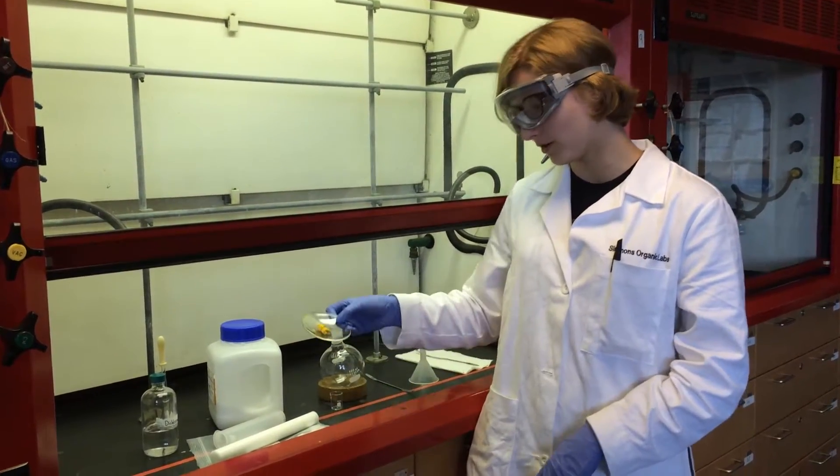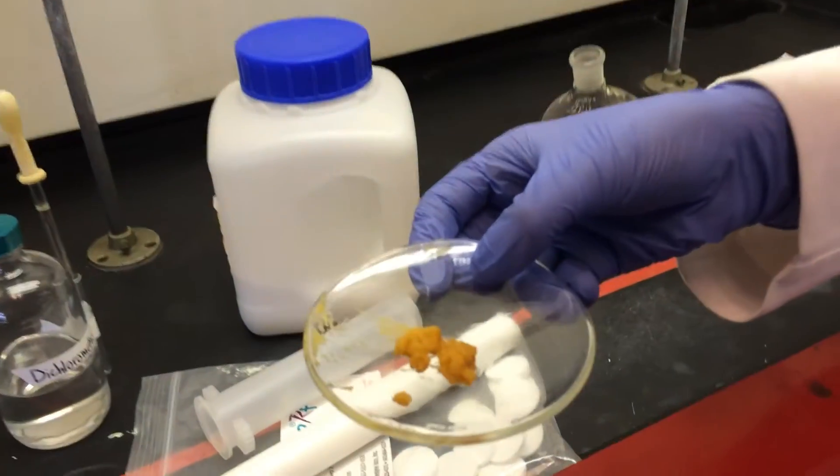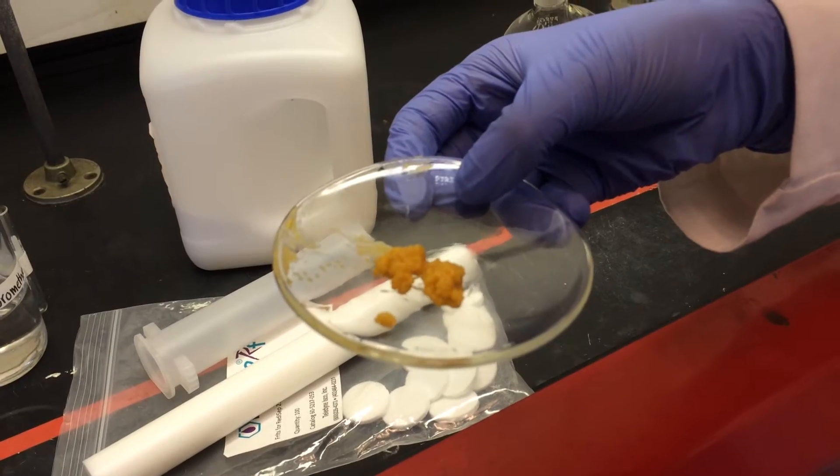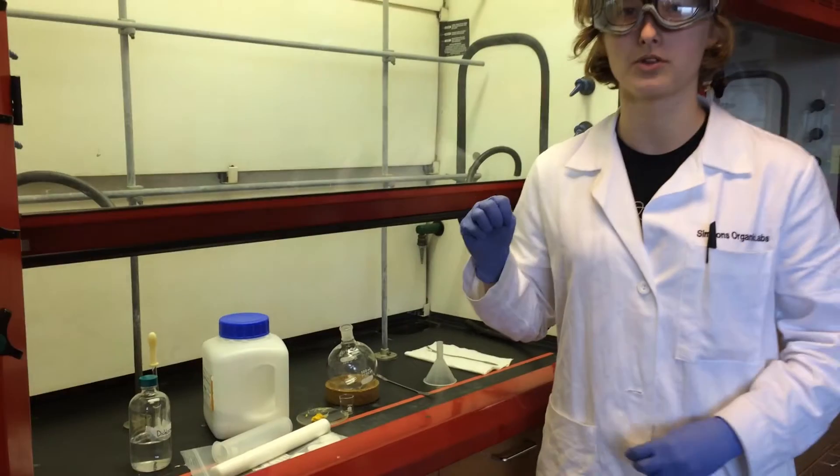However, if you have a gross looking goopy sort of mixture or if it doesn't come off the sides of your reaction vial very easily, I'm going to teach you how to do the silica loading method for the combi.